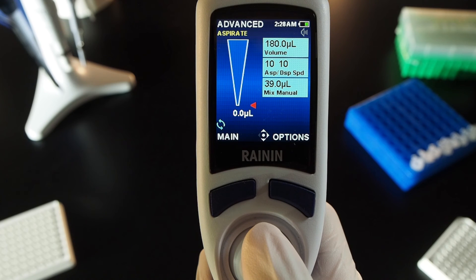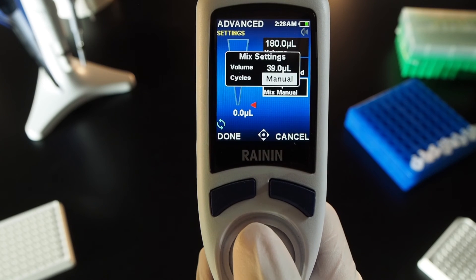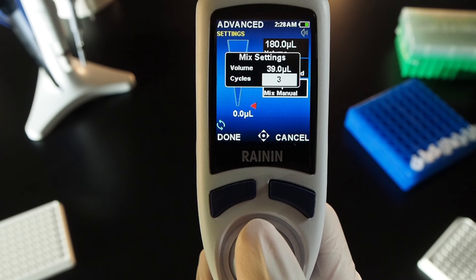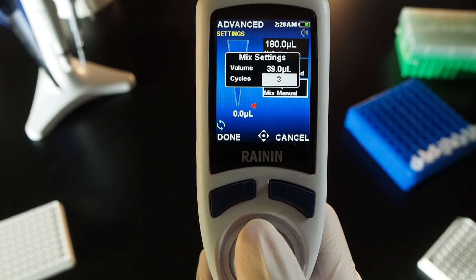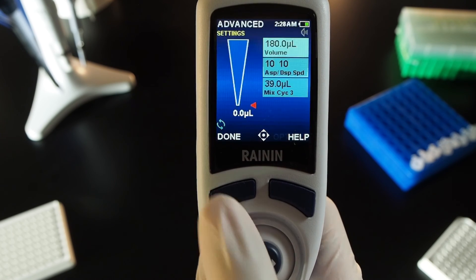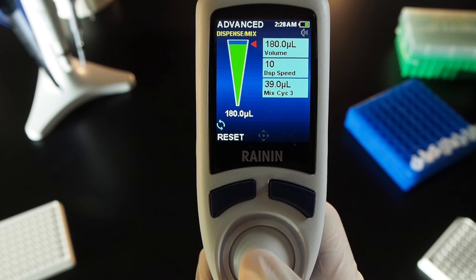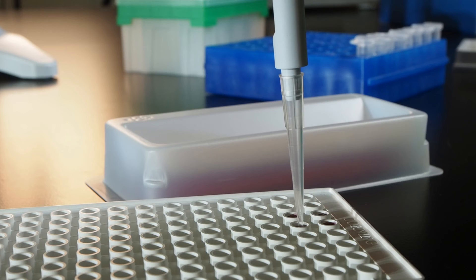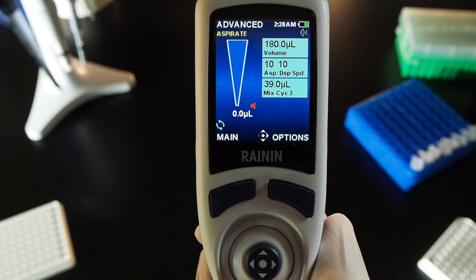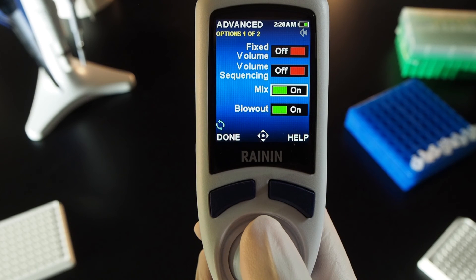To mix a set number of cycles: joystick right to go into settings. Select the mix settings box, select cycles, and select the number of cycles. Press done to exit mix settings, and press done again to exit settings and run the volume. Joystick up to aspirate. Release the joystick after the quick down motion and mix is performed automatically for the set number of cycles. Press options and press the joystick in to turn off mix.